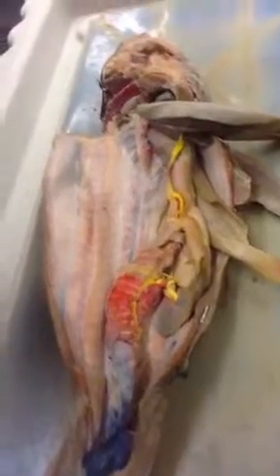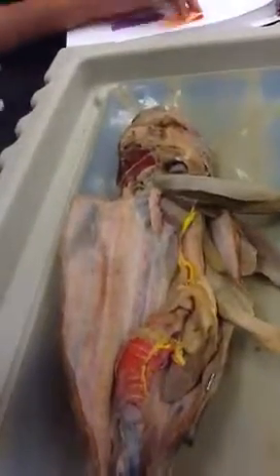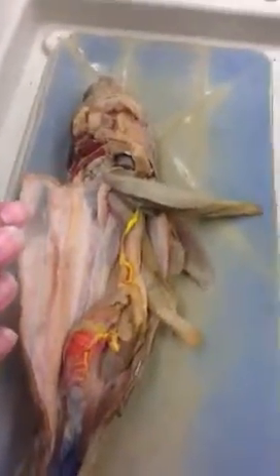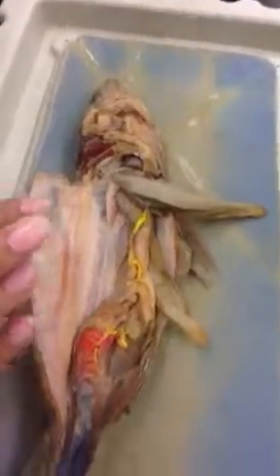Well, actually, before it drains into your sinus venosus, it heads into your common cardinal veins. Yeah, that little arch. The common cardinal vein drains your posterior cardinal sinus, your subclavian, which is also including your brachial, and your anterior cardinal vein. That's what it was.